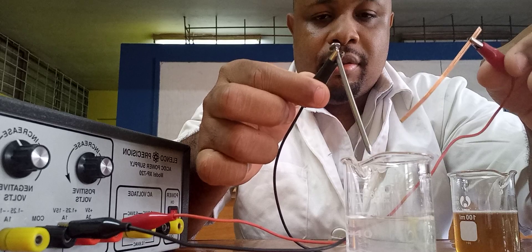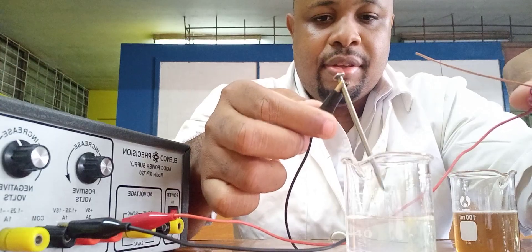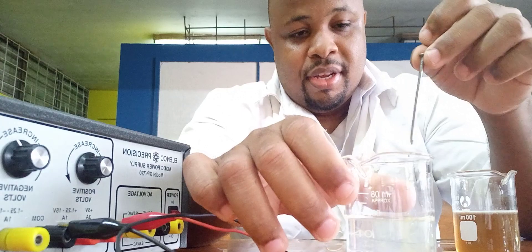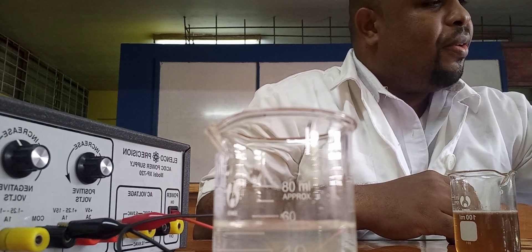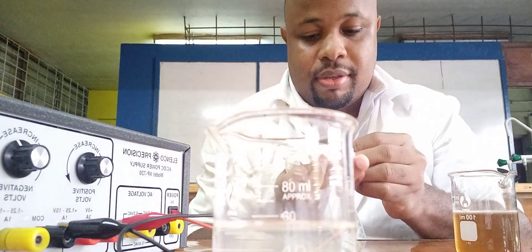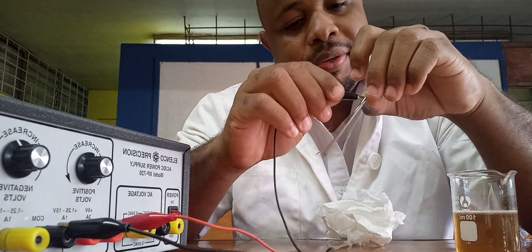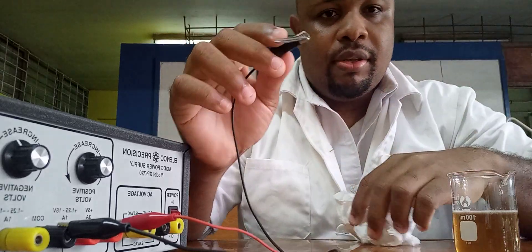We can see that sodium chloride is an electrolyte. Before I put it in the next solution, I am going to rinse it off. I will leave you to determine why I would need to rinse it off in water. Sodium chloride is an electrolyte because we saw the production of bubbles at the zinc nail.